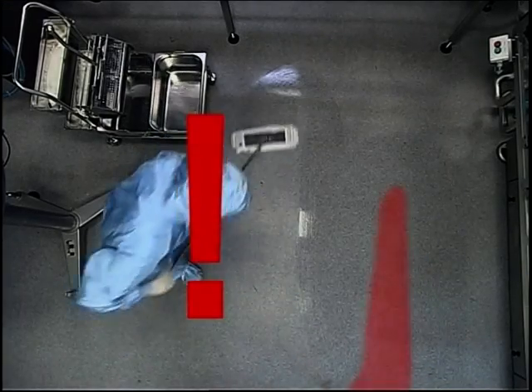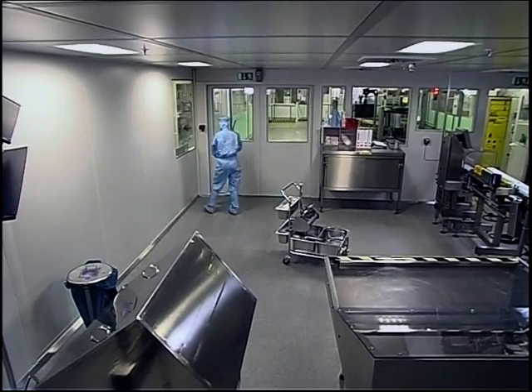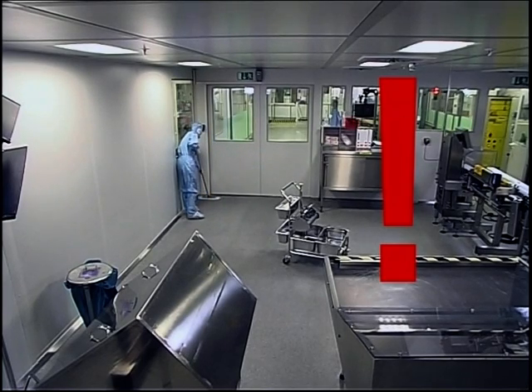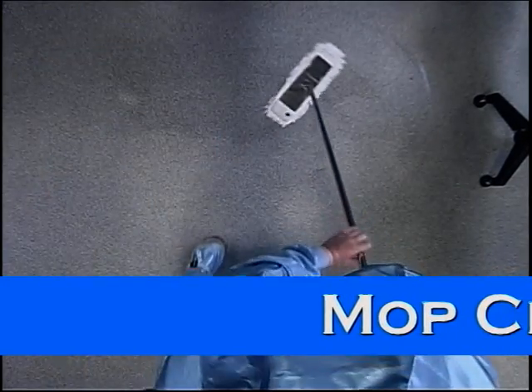What we see here is how it should not be done. Hectic movements and a lack of concentration lead to wiping around the corners rather than right into them and to gaps. Not very good at all. Another point I particularly want to point out: leave the system trolley in the middle of the room. This way it will have to move as little as possible and won't get in your way.